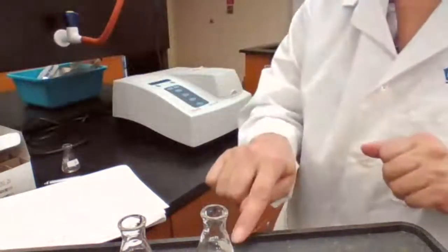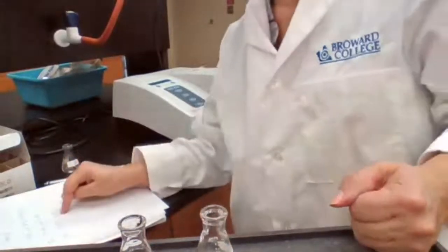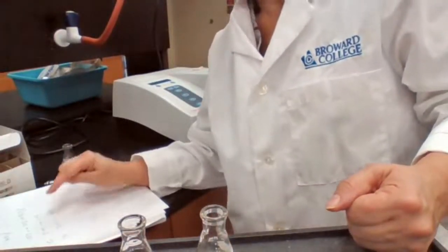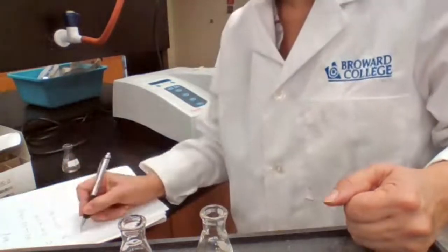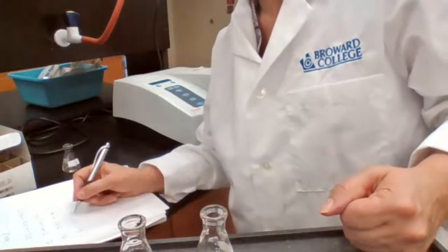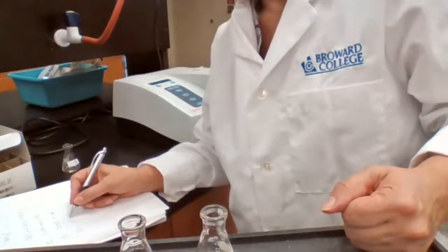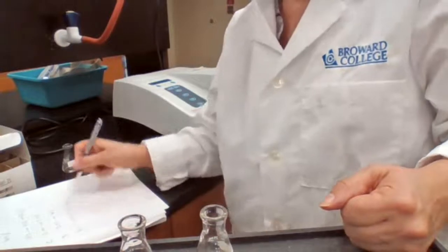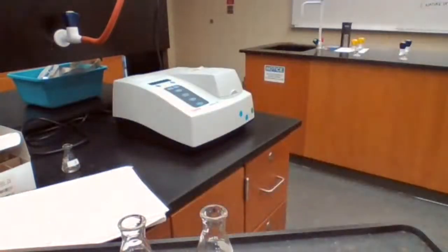Good. Done with sample B. My sample C should go in at 2:05. I have 2 minutes. I can start with my sample E. I'm going to start at 2:04, my sample E.